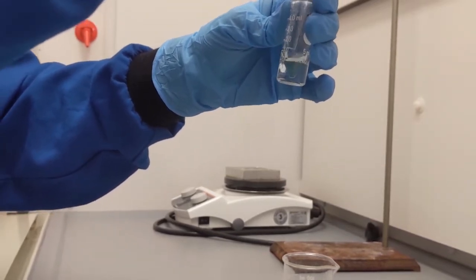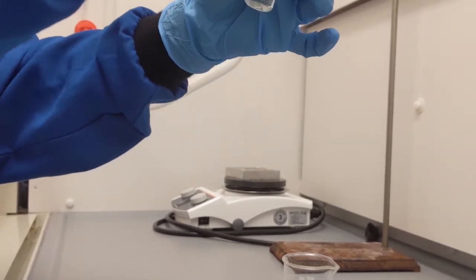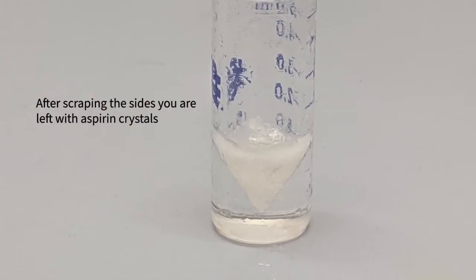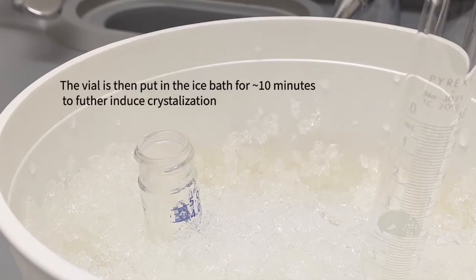If the crystallization does not begin, you can use a glass rod to scratch the edges of the walls to induce crystallization. In the end, you should see white crystals. And then move on to put your conical vial into an ice bath.